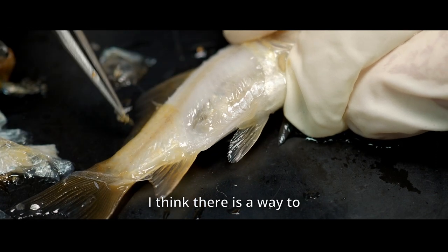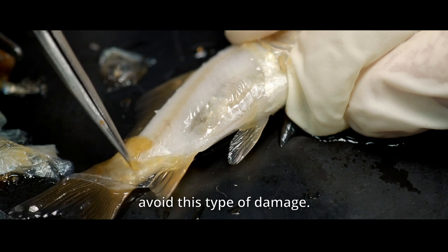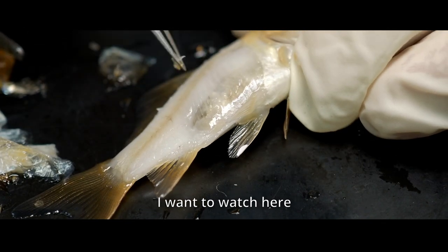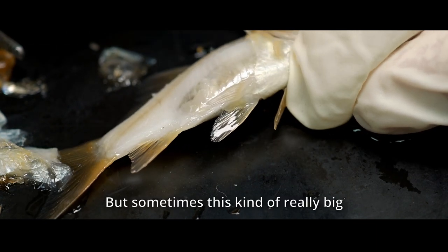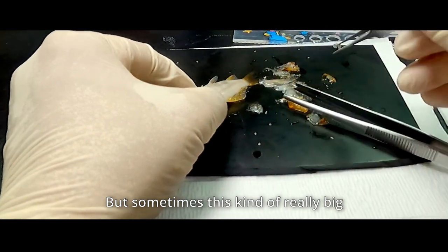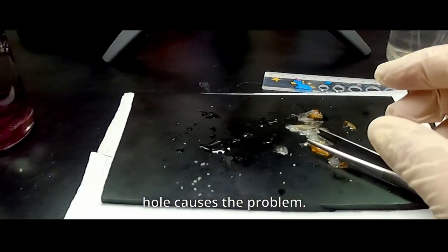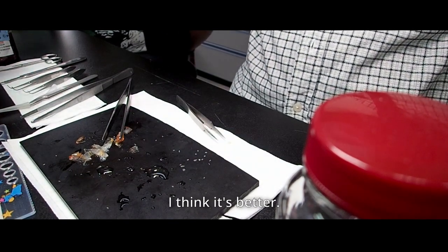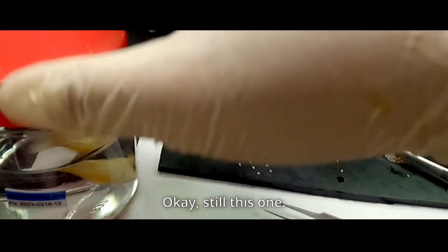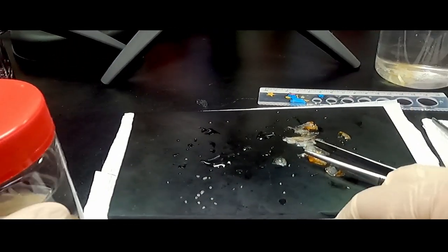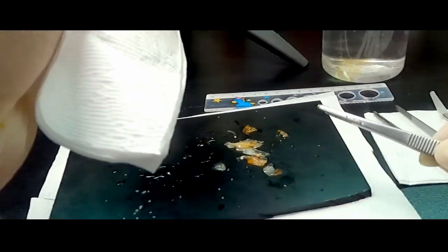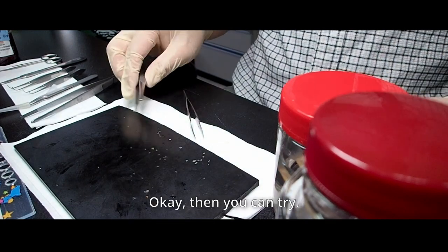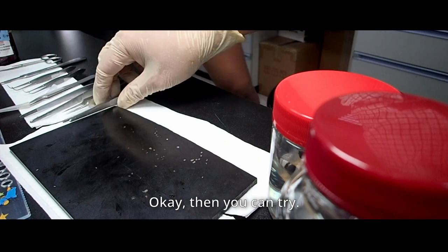Slightly made hole. I think there is a way to avoid this type of damage. I want to watch here and then I don't care, but sometimes this kind of really big hole causes the problem. I think it's better. Okay, still, this one is detailed. Okay then, you can give it a try.